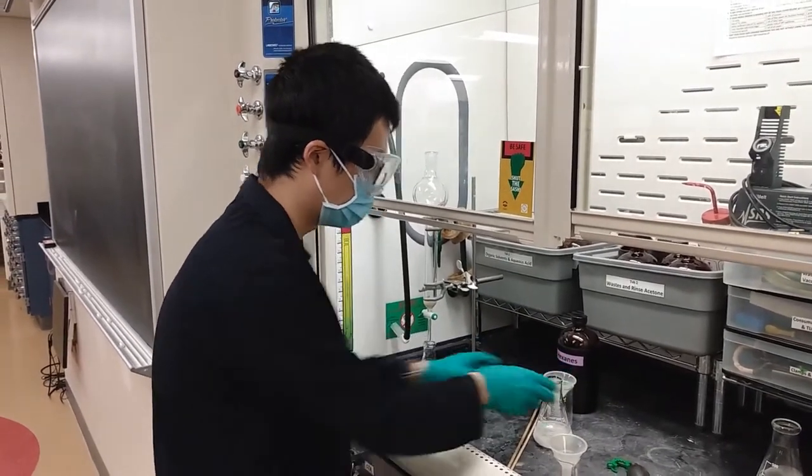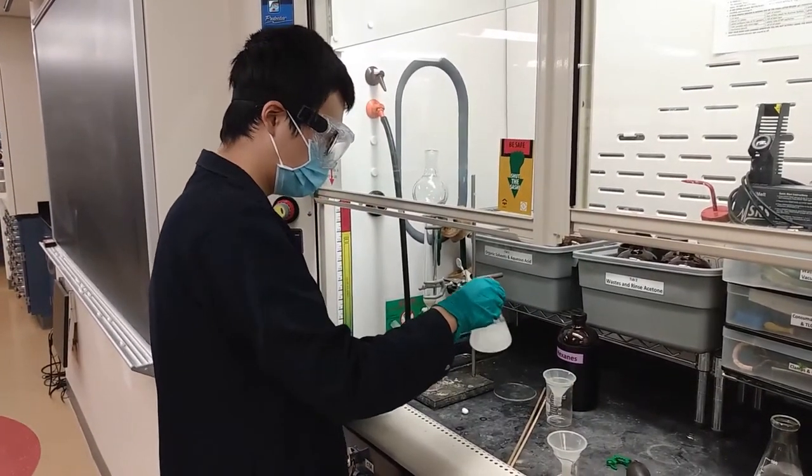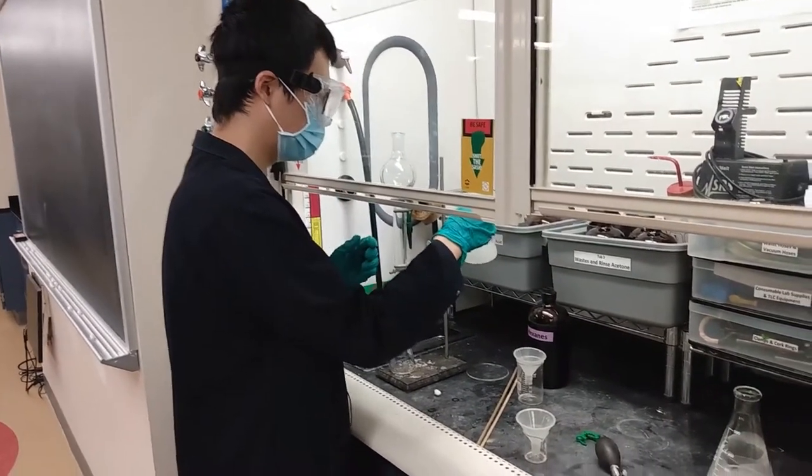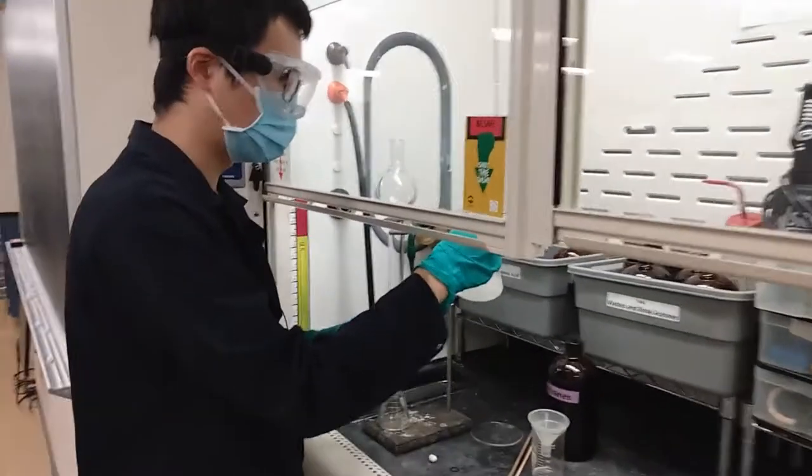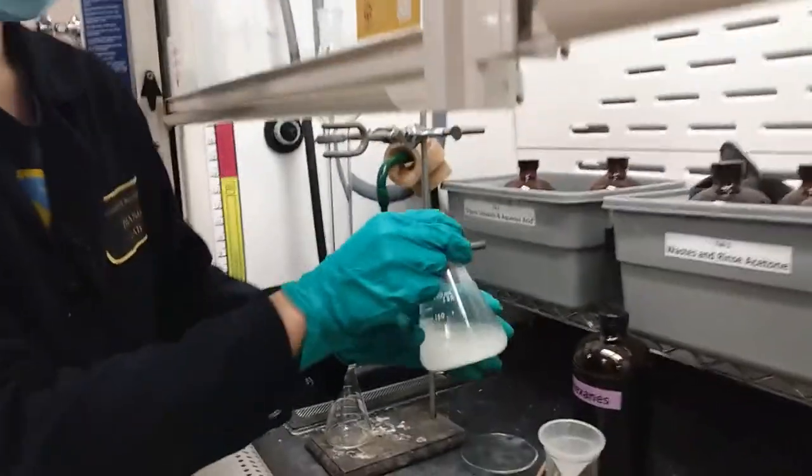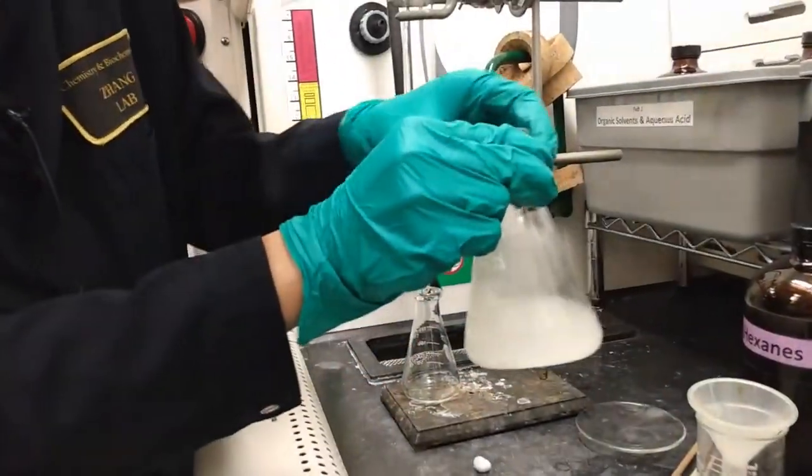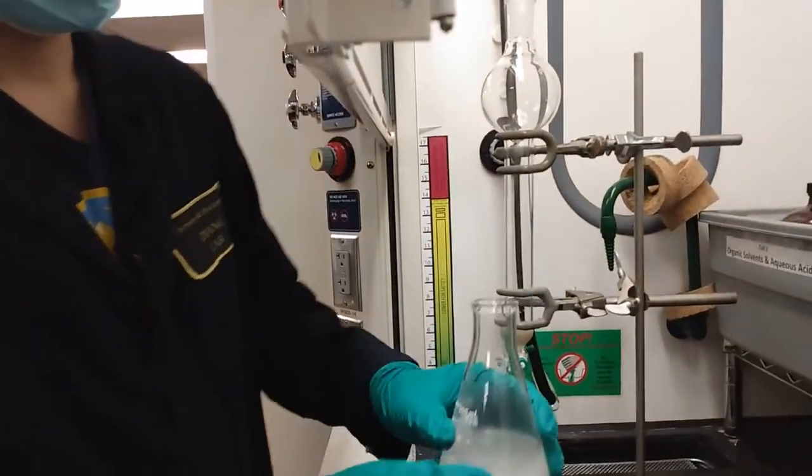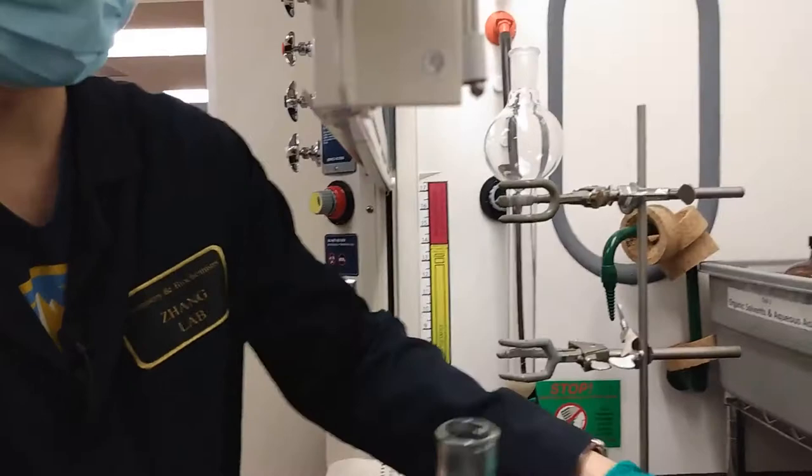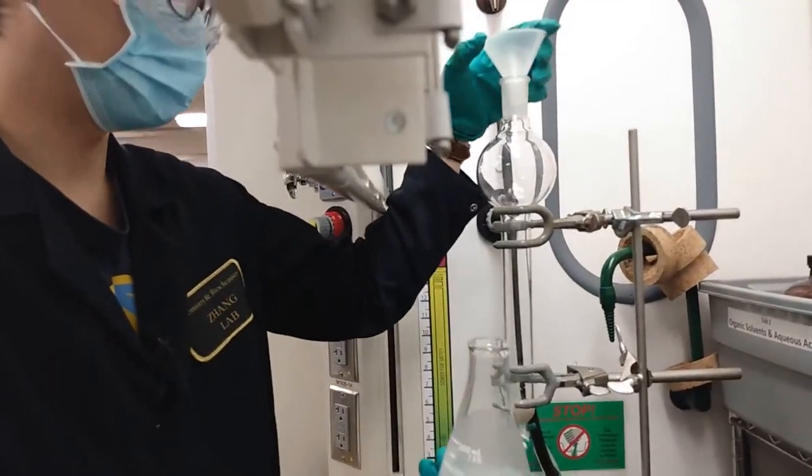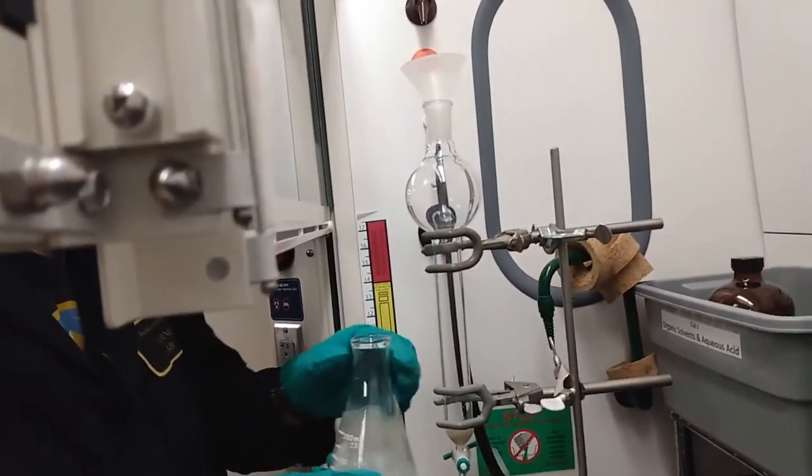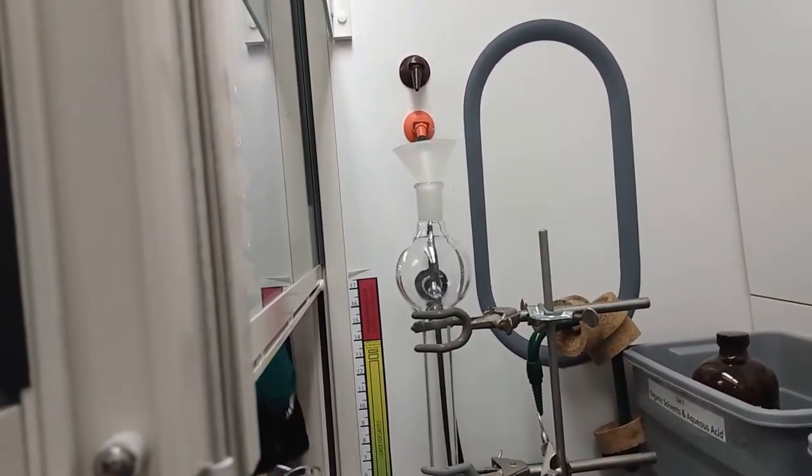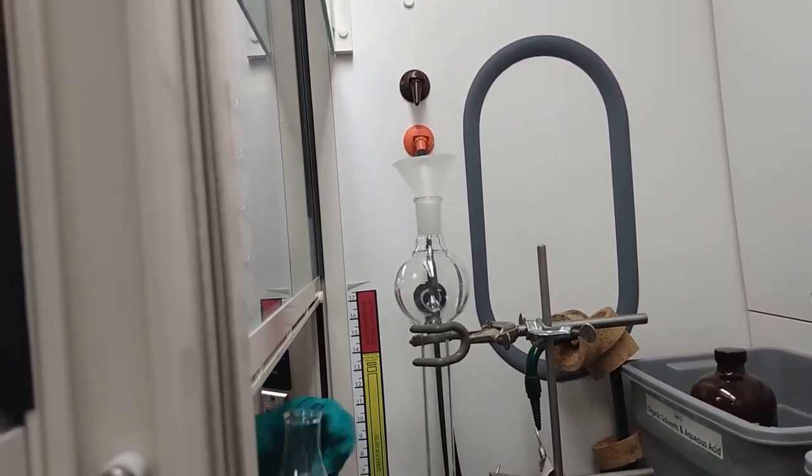Be very careful because it's very fluffy. Shake it just to make the silica gel powder into a slurry like that. Next we pour this into the column. This step will get rid of all the air in the silica gel to avoid any bubbles in the column.